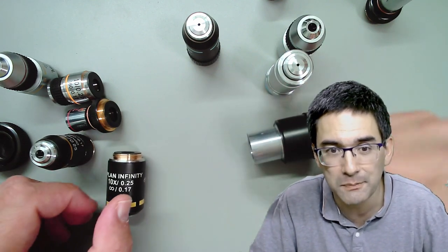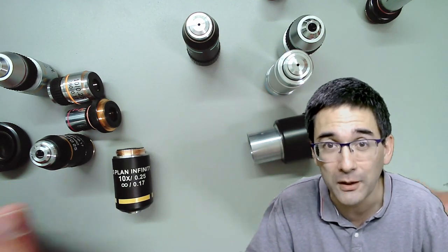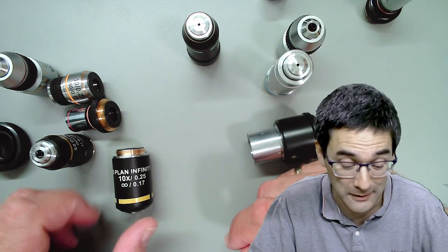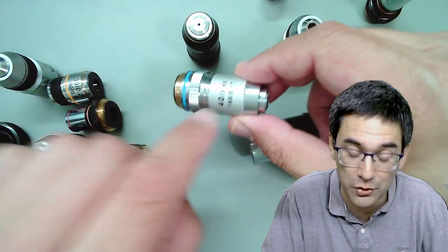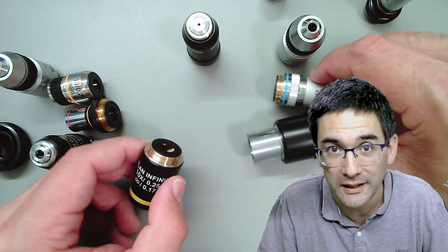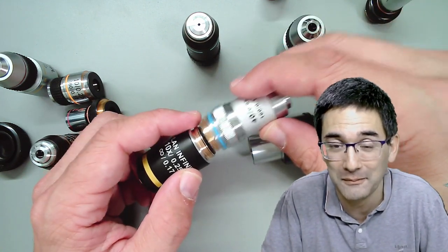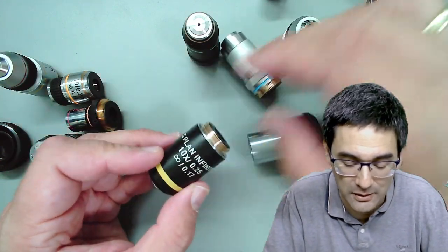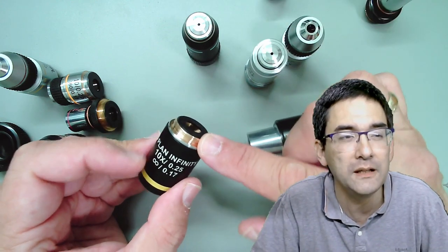I've already received emails where people ask if they can buy an objective to upgrade their microscope. You have to be careful: if you have a 160mm microscope and want to attach an infinity objective, it doesn't work. It will physically fit on the microscope - the threading is the same size - but optically it won't work and you'll get a blurred image, because you need the tube lens and all these other elements.